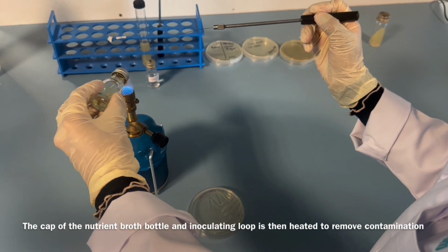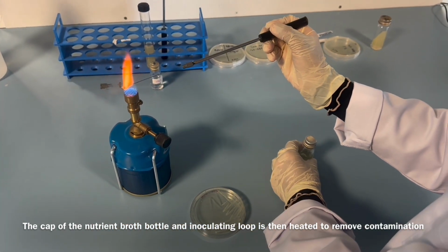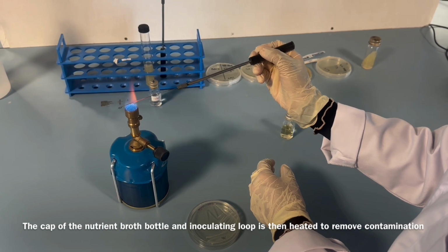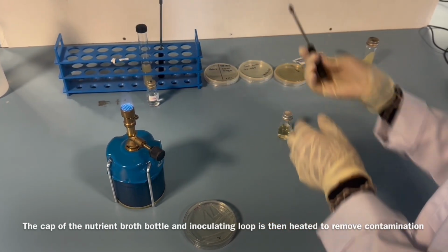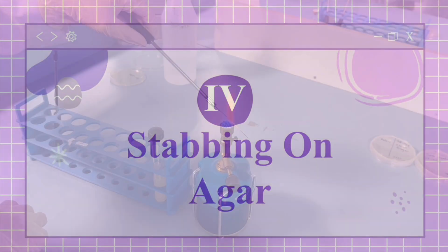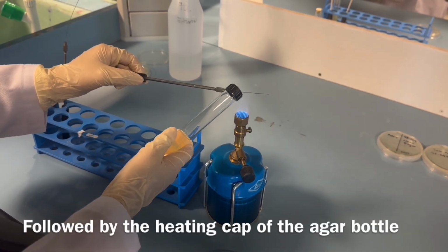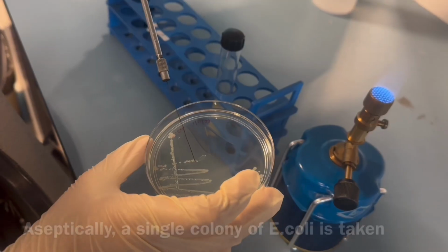The cap of the nutrient broth bottle and inoculating loop is then heated to remove any contamination. So that is done. So moving on to the other experiments, stabbing on agar, heating of inoculating wire is done first. Note that in this experiment we are using inoculating wire and not inoculating loop. And then followed by the heating of the cap of the agar bottle.